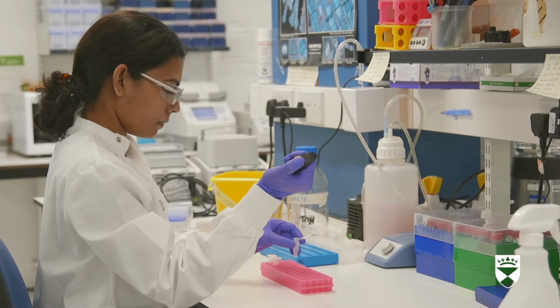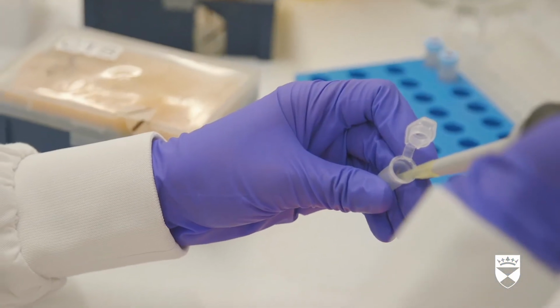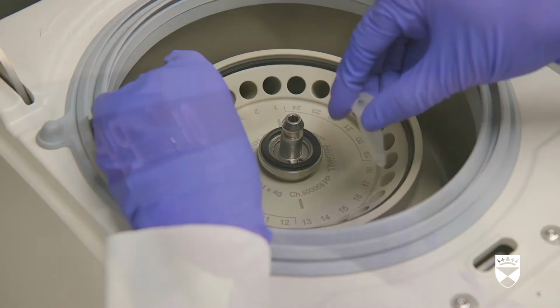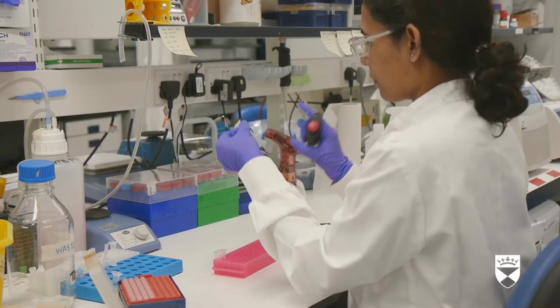The scientist pipettes detergent into a sample tube and then places the tube into a centrifuge. She then studies the tubes. Sediment has gathered at the bottom of both tubes. To get to them, we break open the T-cells by adding detergent. We collect the protein and wash it several times. She adds an enzyme to one of the tubes, then taps it with her finger. She places the two tubes into a thermal mixer.